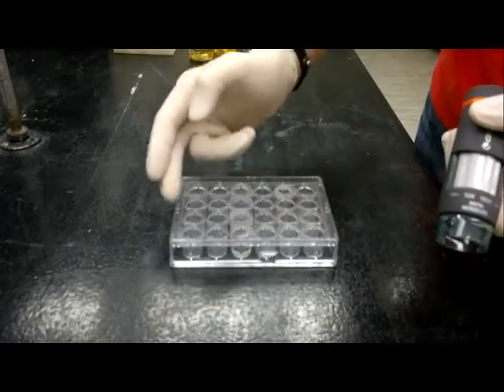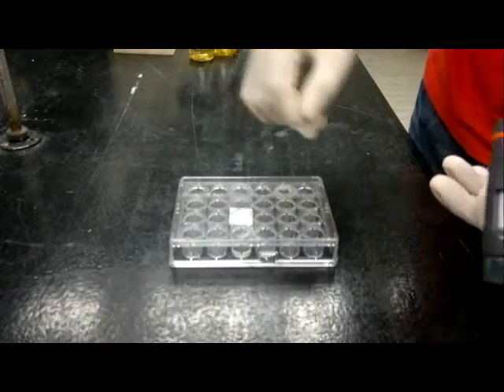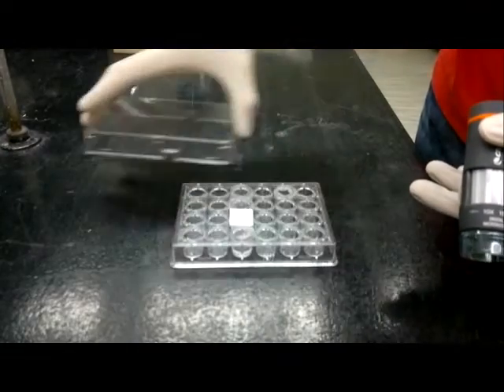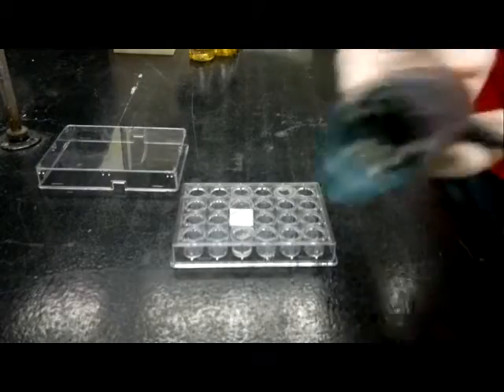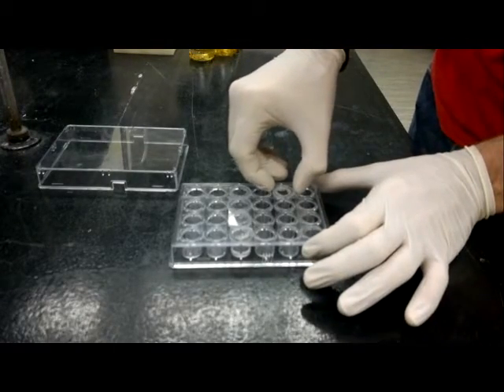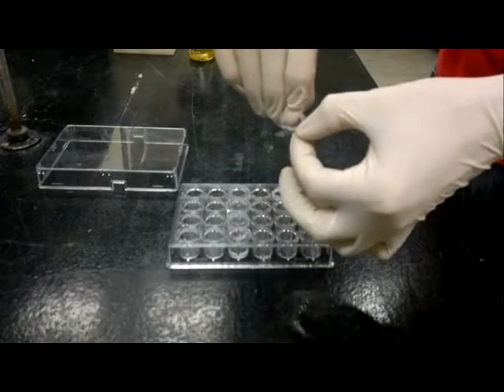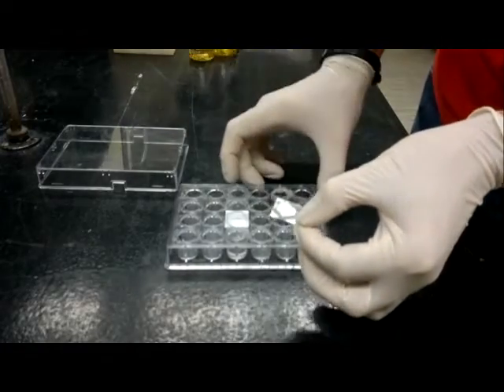When you've determined which wells have potential protein crystals, let's say it's this well, the most promising one. You're then setting your microscope aside. You can, with a pair of forceps or with your fingers, carefully remove the cover slip. It will still have a bead of petroleum jelly or vacuum grease on it.